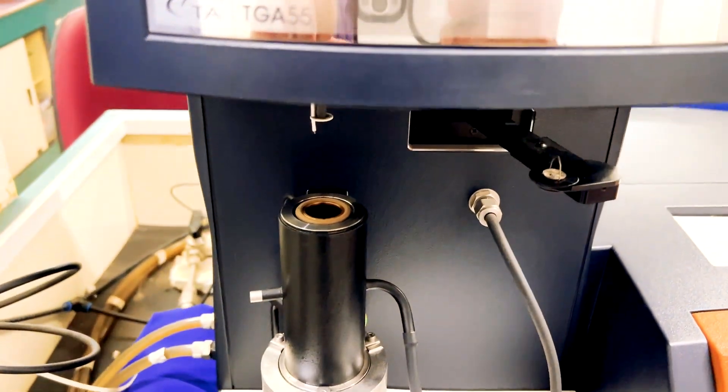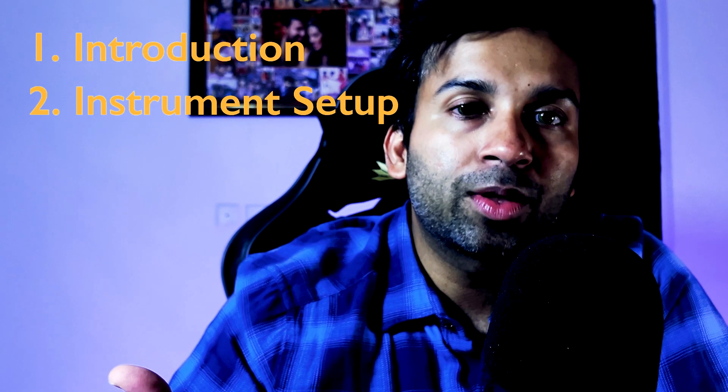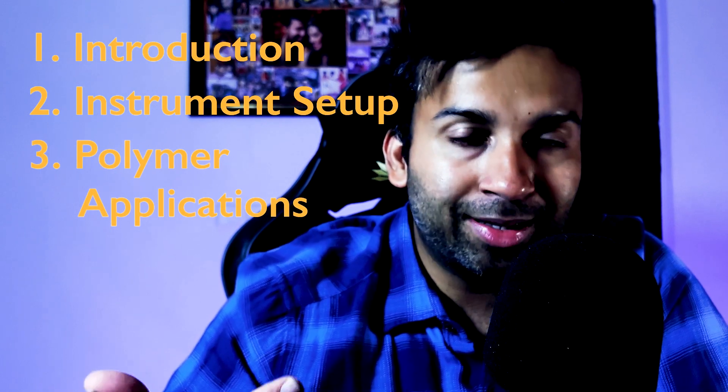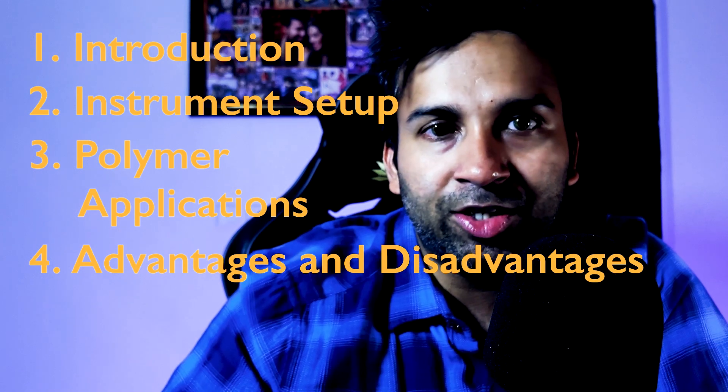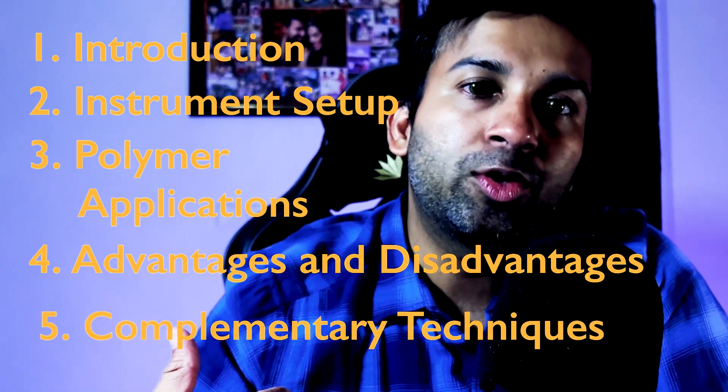Hey everyone, welcome to this video where we'll be looking at thermogravimetric analysis or TGA. This shows the thermal behavior of polymers, or more specifically, how the weight of the polymer changes as a function of temperature. We'll be looking at the introduction of TGA, the instrument setup, the applications related to polymers, the advantages and disadvantages of TGA, and finally other complementary techniques that can give you a full view of the polymers.